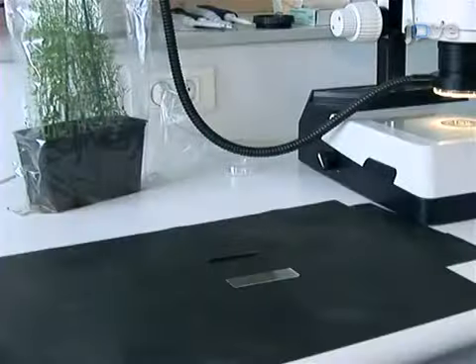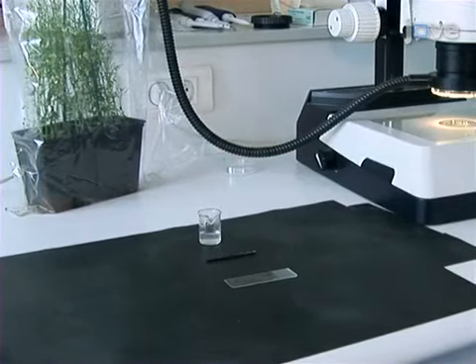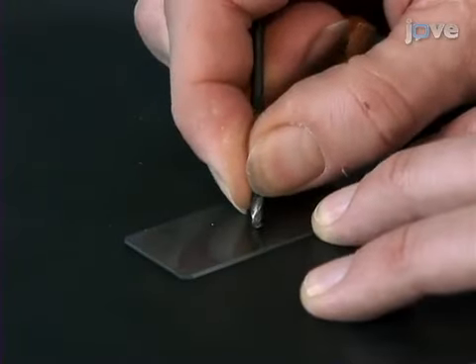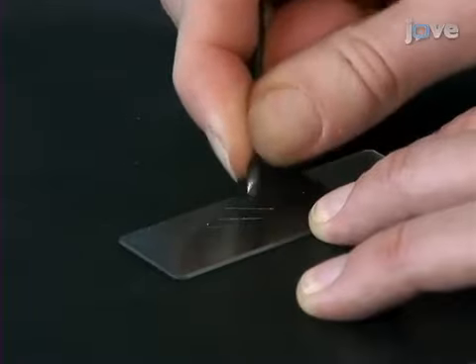The agarose media for embedding samples is prepared from 0.7% low melting temperature agarose in 10% mannitol in water. Using a strong metal instrument, such as a drill tip, etch out a 0.5 by 0.5 cm area in the center of a microscopy glass slide.